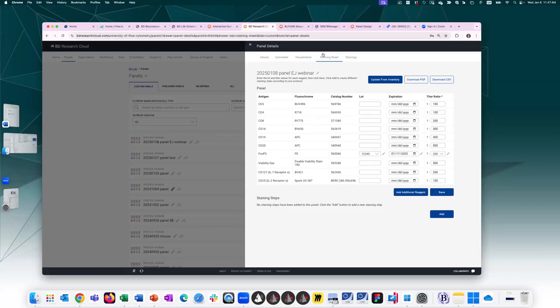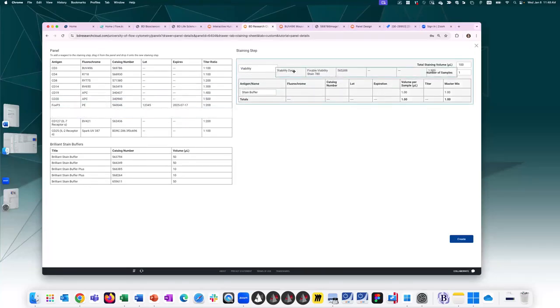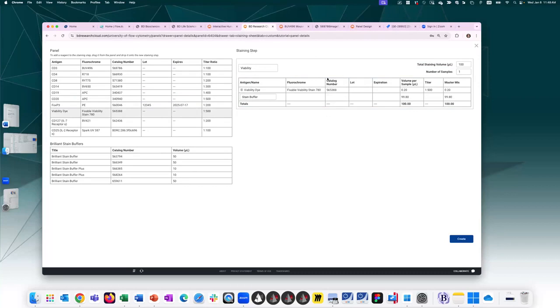By creating a staining sheet, I will just simply assign which markers will be used in different staining steps in the lab. So let's go ahead and click add. Here is the panel that I've created on the left-hand side, and here is my first staining step. Let's say staining step 1 is just viability. So I want to bring in, this is a drag and drop functionality. I can drag and drop the viability dye into this table.